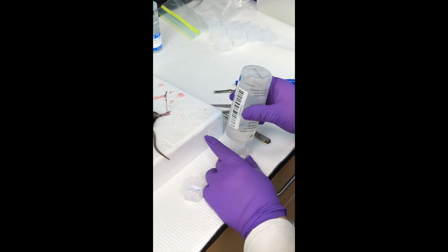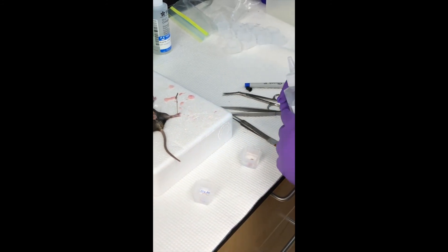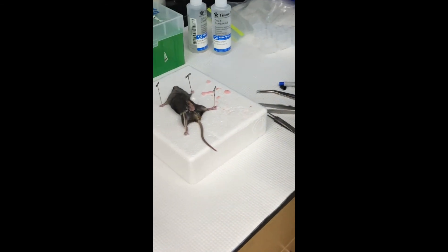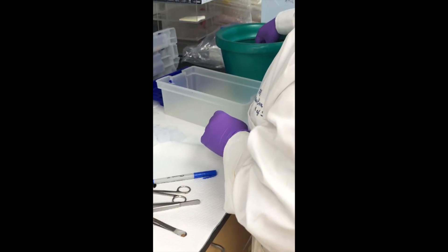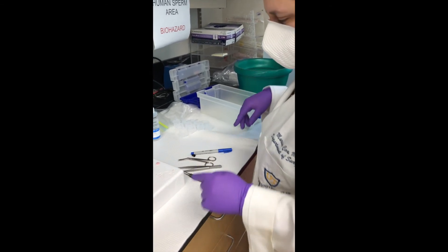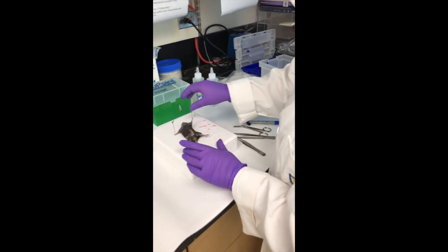When you do this, it's nice to keep it around the edges because it'll keep it from forming bubbles. Going around the outside — and that's it. We need to put these back in here. You see these ones are already starting to freeze. I'll leave them on here for a little while, and then when I'm done I'm going to put them in minus 80, and then we'll take them over to histology whenever we go over there.